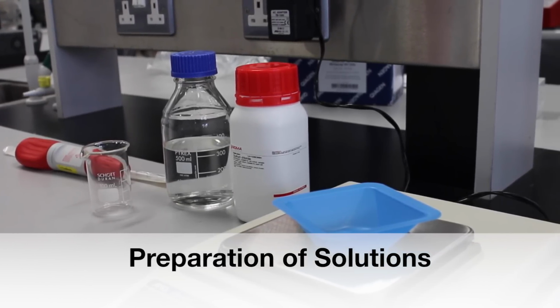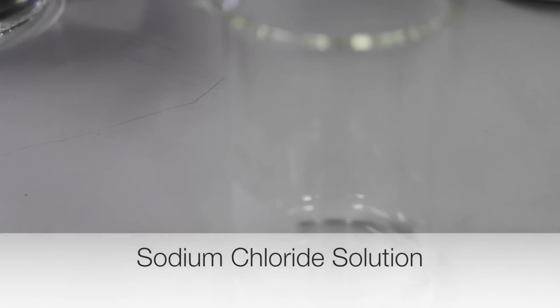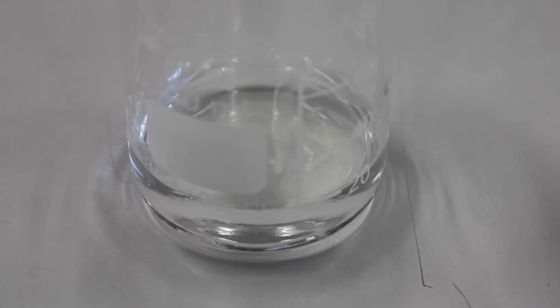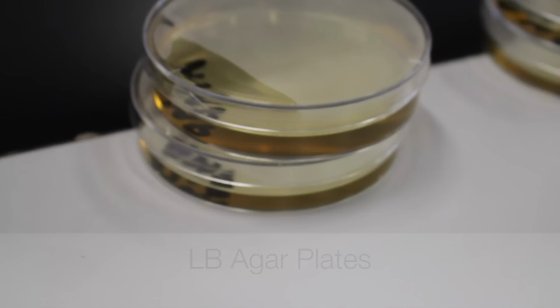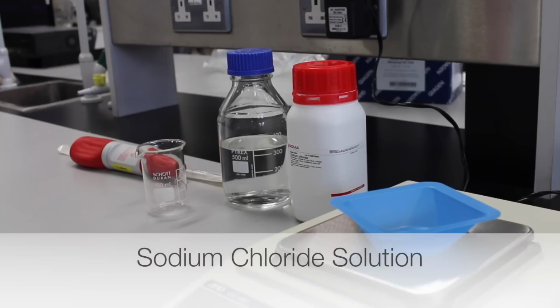This tutorial shows how to prepare a variety of solutions, including sodium chloride solution, glycerol solution, calcium chloride solution, TBE buffer, LB medium, and an LB Agar plate containing antibiotics.